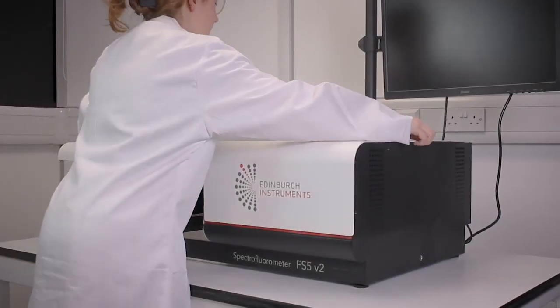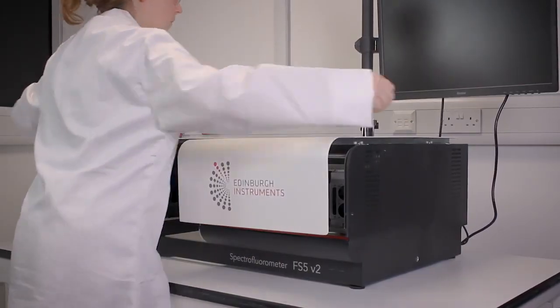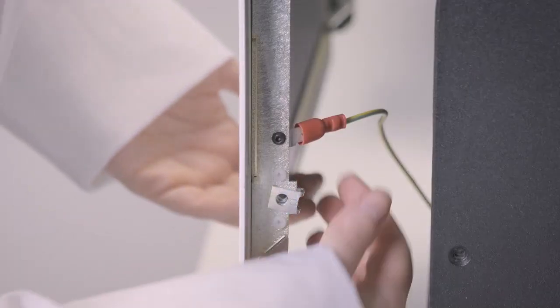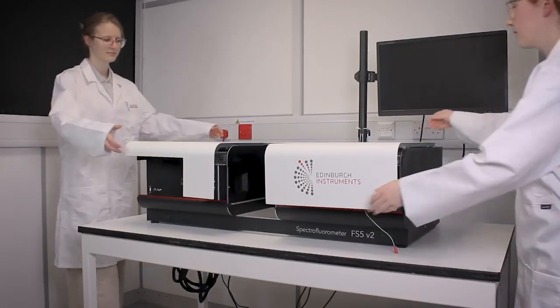To remove the white cover, pull it towards you and lift upwards. Before removing it completely, detach the grounding cable as shown. Now, 2 people can carefully lift off the cover.